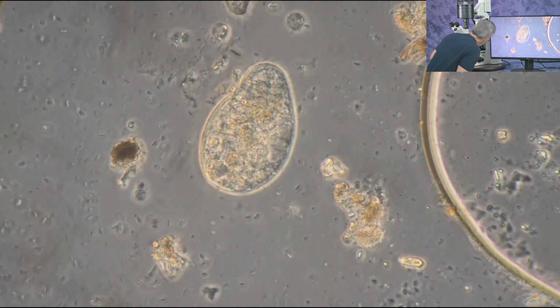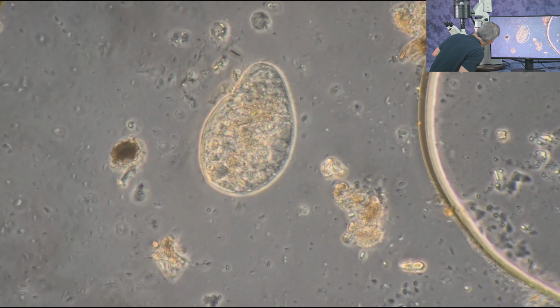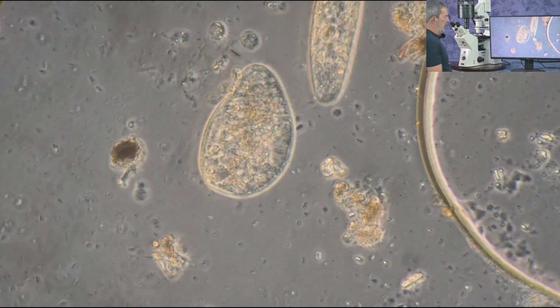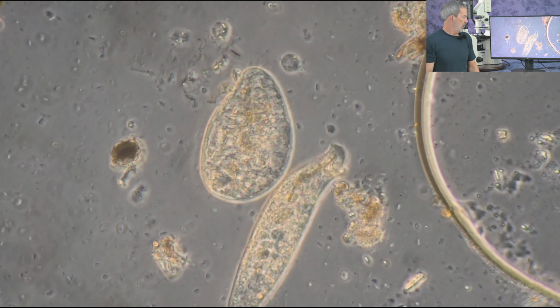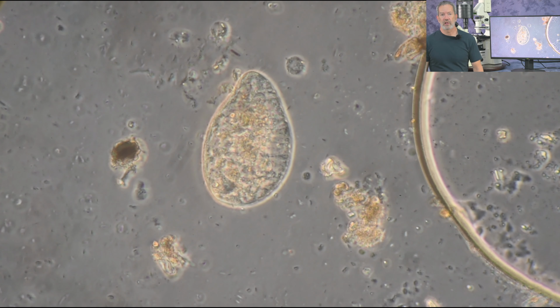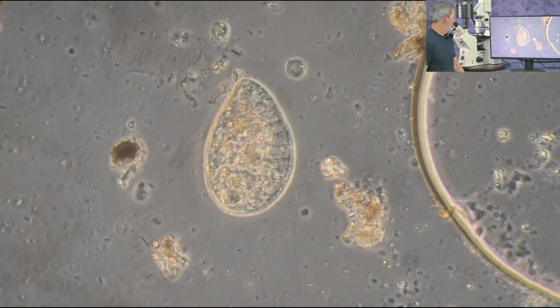Okay, at this point we've gone through 10, 20, 40, two different 40 objectives. Looking at Varel contrast and looking at phase contrast, and just quickly switching over to bright field to see how everything is washed out without any contrasting at all.